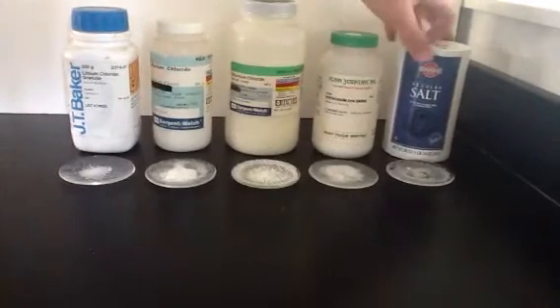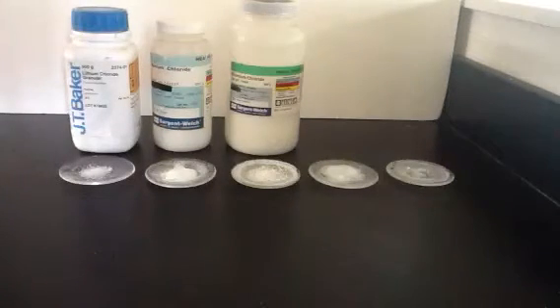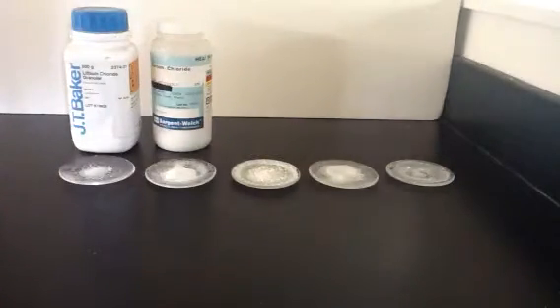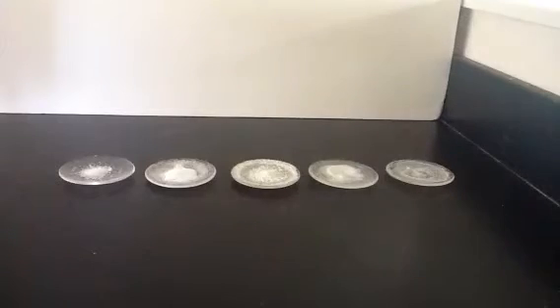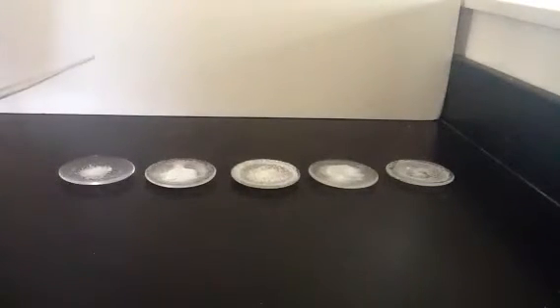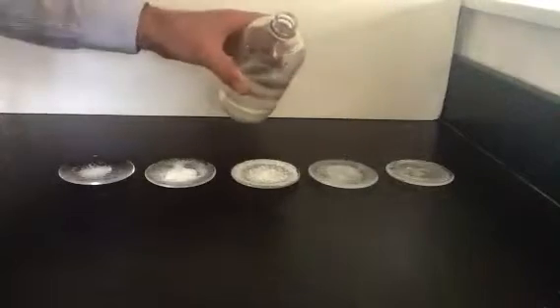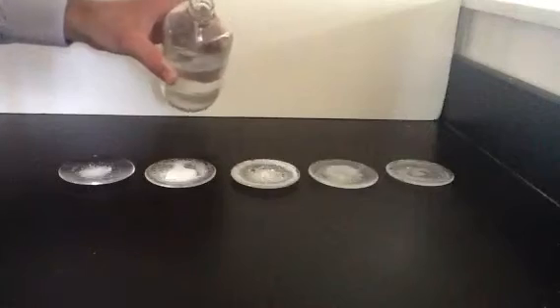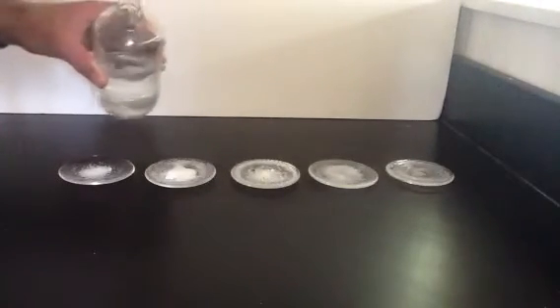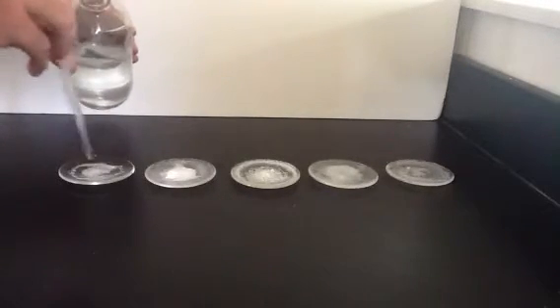From the right, we have sodium — this is just regular table salt. I've put a little bit in a glass tray. We have potassium chloride next, strontium chloride, and barium chloride and lithium chloride — just a small amount of salt in each one of the dishes. Now I'm going to add some methanol. Methanol is a combustible liquid, so we'll add a little bit to each of these. The methanol will burn, and as it's burning, it will heat the salts and the salts will give off characteristic colors. This is useful for identifying different cations that are present in unknown solutions.